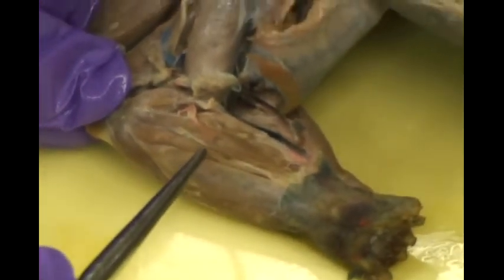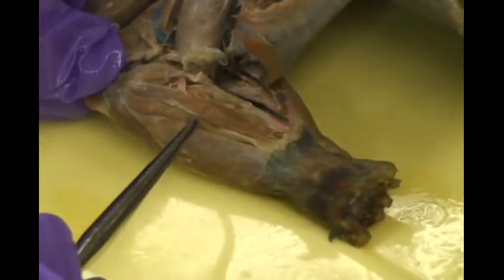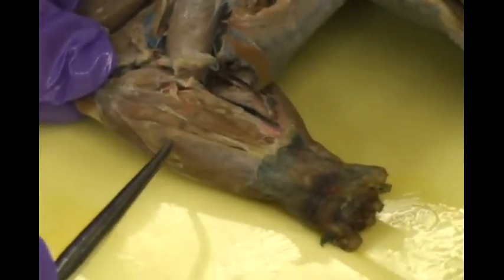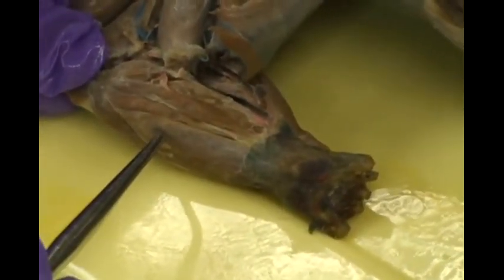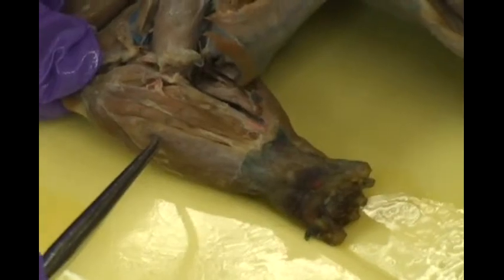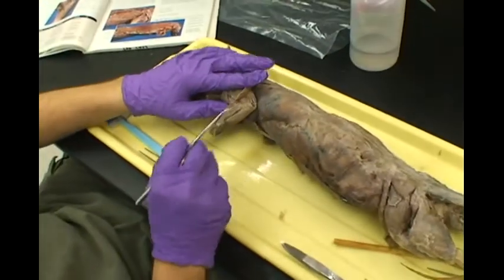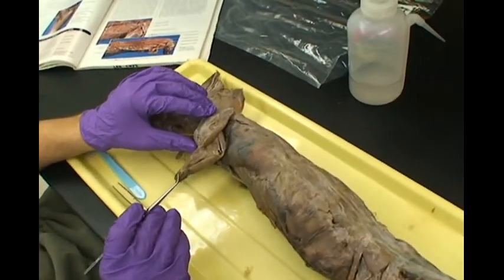Caudal to that is the flexor digitorum profundus, and finally, caudal to that, you will see the flexor digitorum superficialis. That should cover the forelimb.